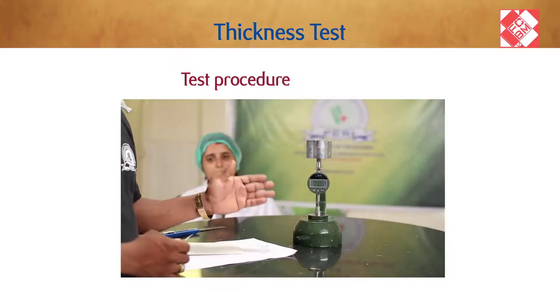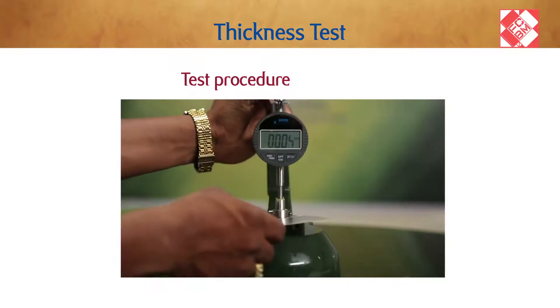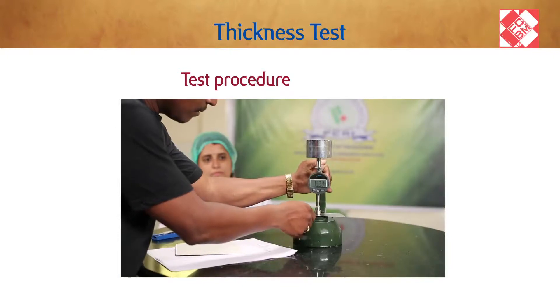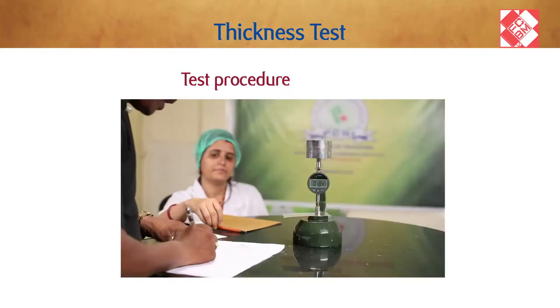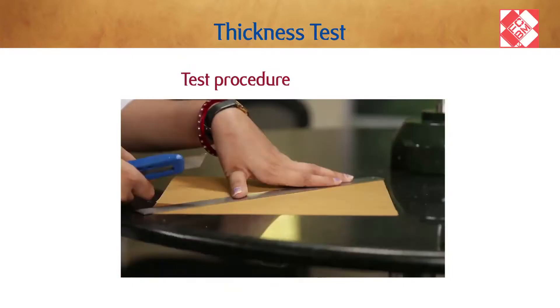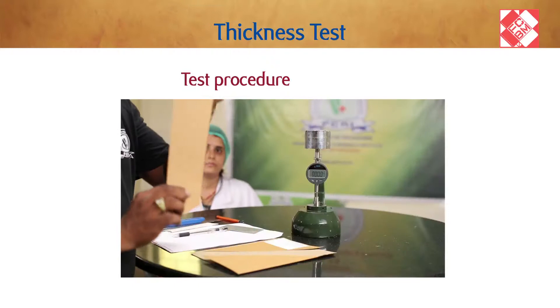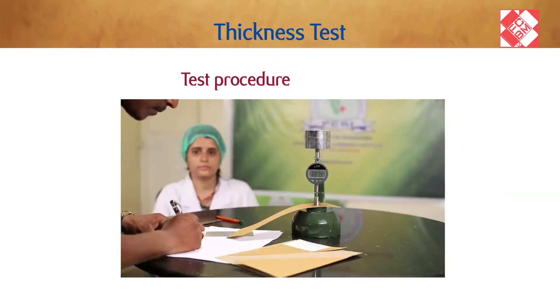Test procedure: the micrometer should be installed on a stable horizontal bench top, free from vibrations. The specimen should be placed between the open measuring faces and the micrometer operated so that the upper face lowers onto the specimen. The lower face should contact the specimen at least 20 millimeters from any edge.